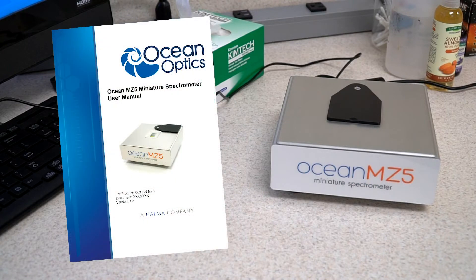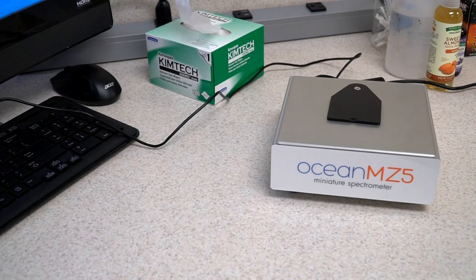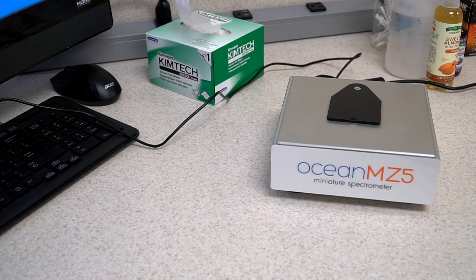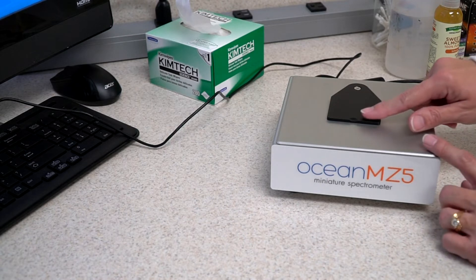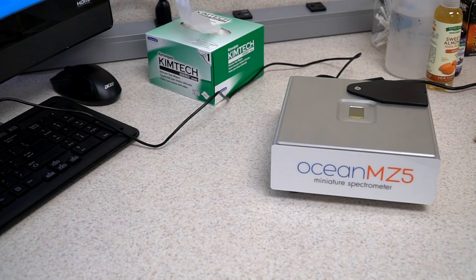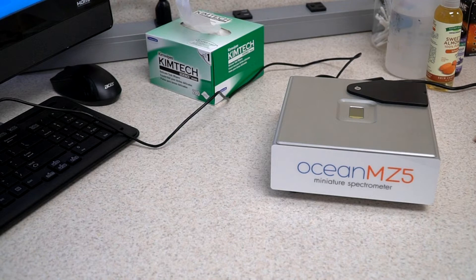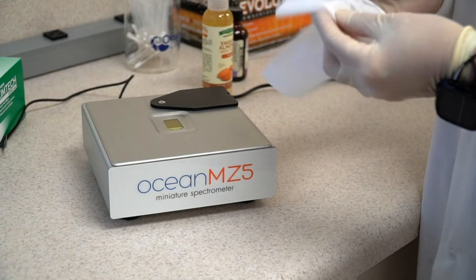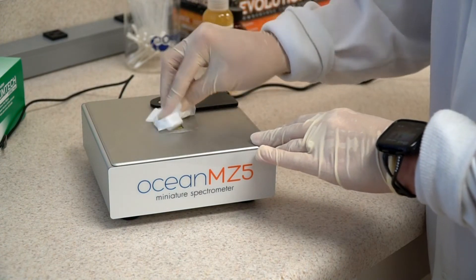See the user's guide for more information. Now you're finally ready to start your measurements. The crystal sample surface is protected by a black plastic cover. Rotate the cover away from the crystal and verify that your crystal surface is free of defects. If any abnormalities are found, contact OceanOptics support before using your MZ5. After inspection, clean the crystal to remove any contaminants.